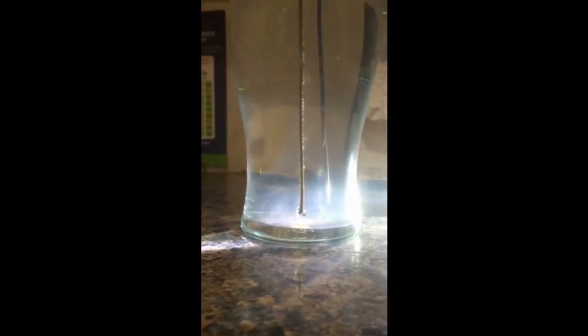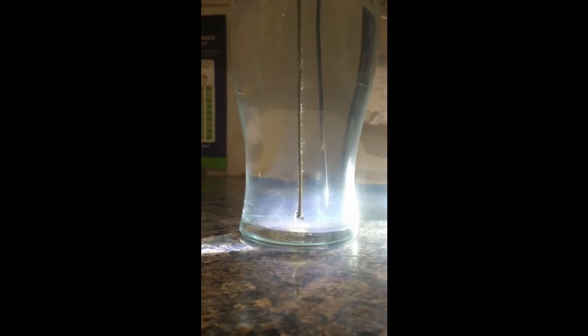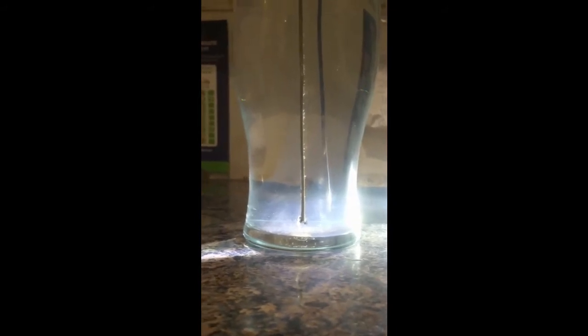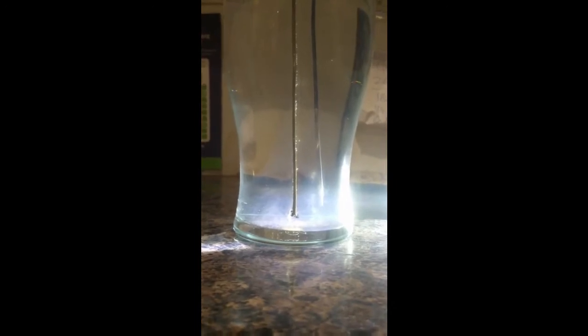The issue there is that the rod gets completely caked up with crap before you manage to get many ions into the water. So inevitably you end up with quite a weak solution, quite simply because the rod gets so caked up with rubbish that you have to stop the experiment and make do with what you've got.